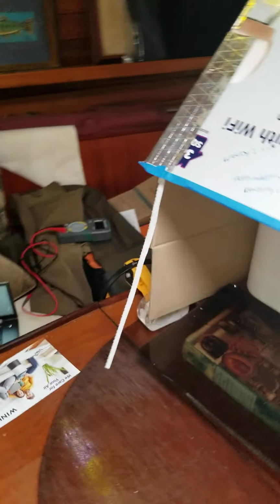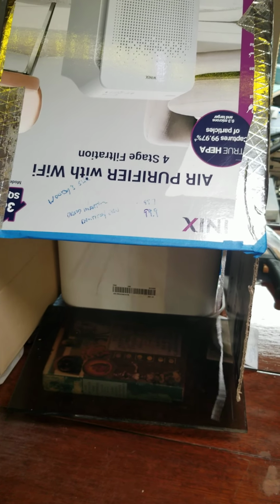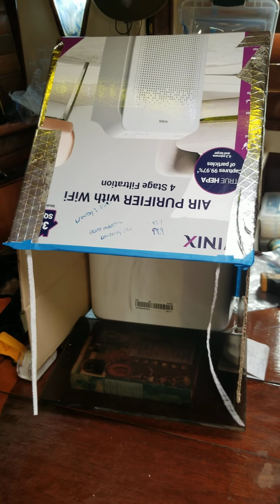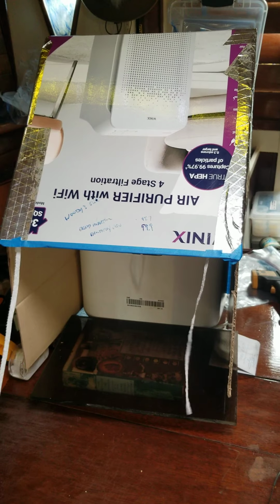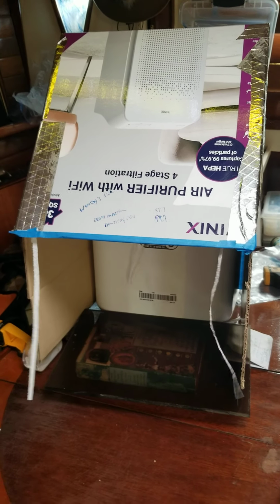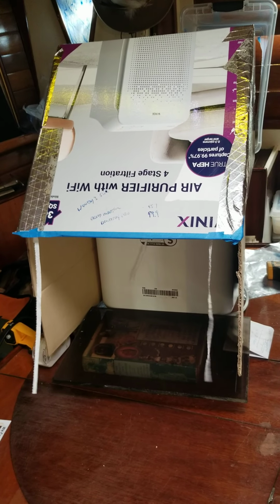So I've tried to do inoculations and agar, and the only time I get anything to grow is when I have contamination. So I need a flow hood, and they will tell me that a still air box will work, and I find that not for me it doesn't, because there's just too many issues here.